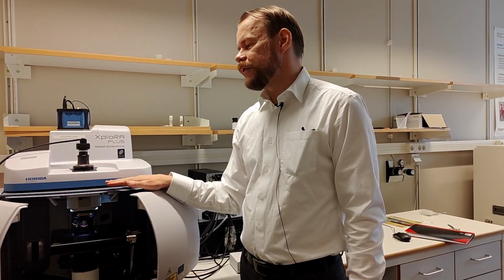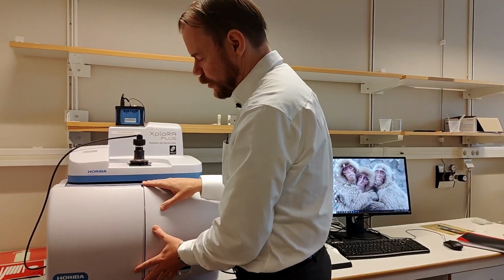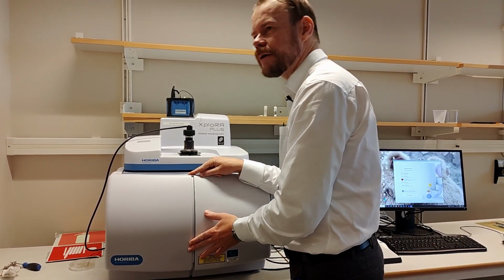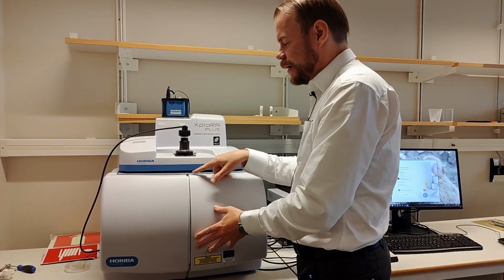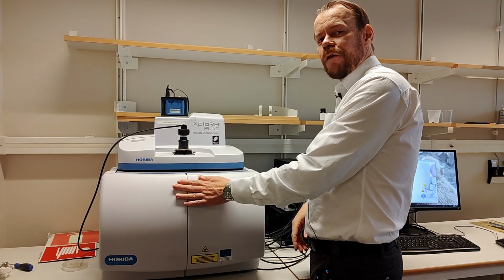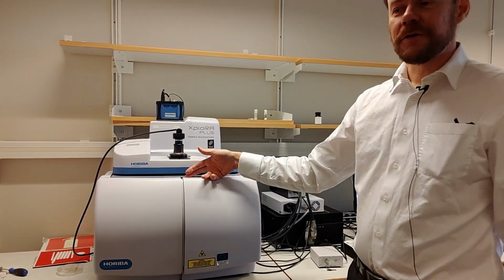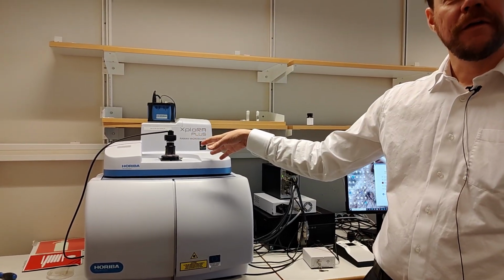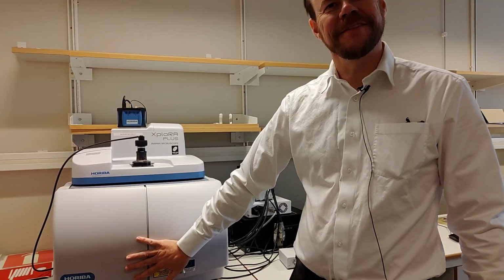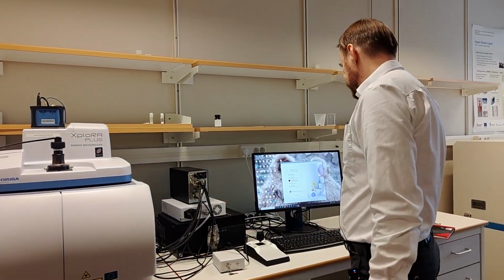But there is something to take notice of here. When I close it now, you can hear a little clicking sound. There are two micro switches. So when you close, you must make sure it is fully closed. If this is a little bit open, then the switch is not closed, and that means the laser is off. And then you're wondering, why don't I see any signal? Because you haven't closed the box. It's very important to close the box, right? So that is a nice thing to make sure of.